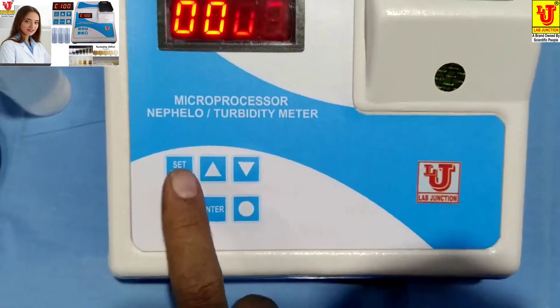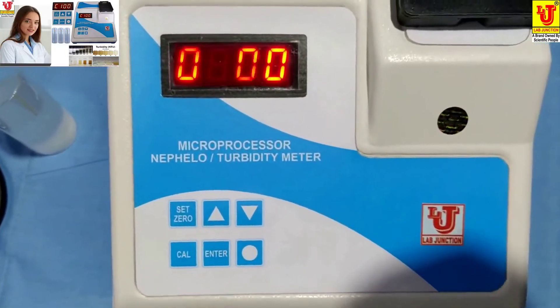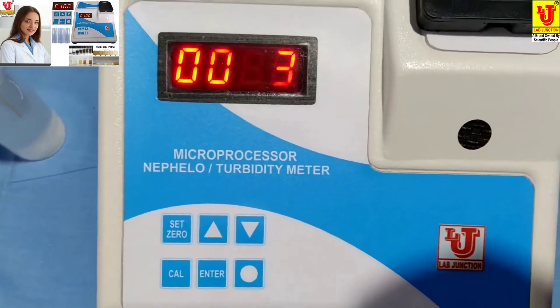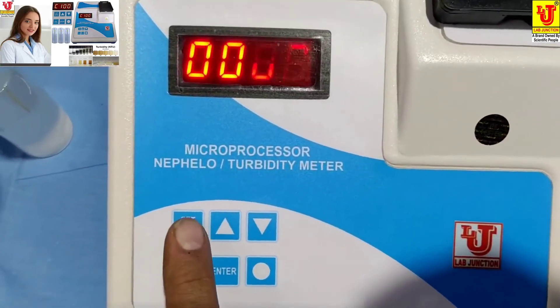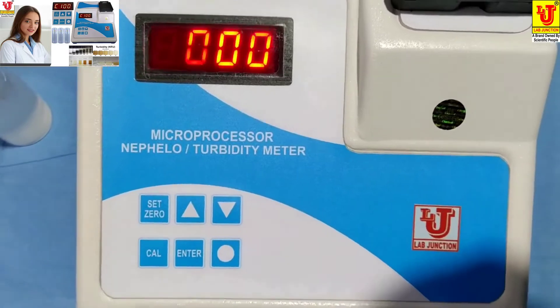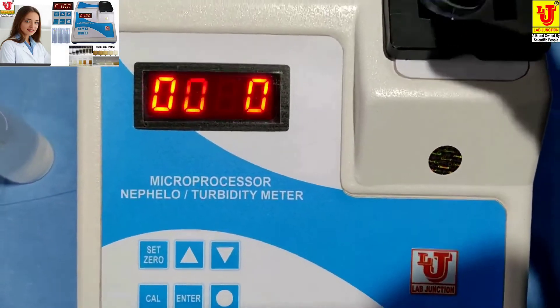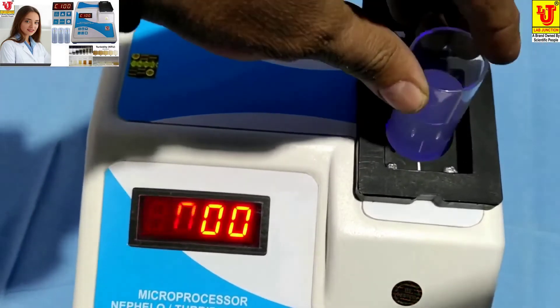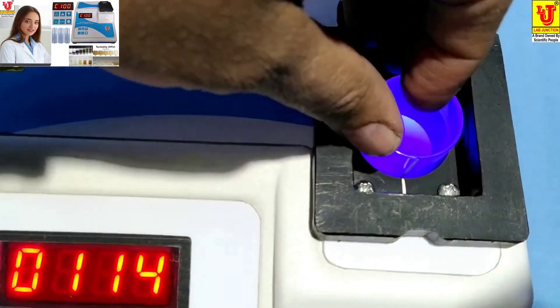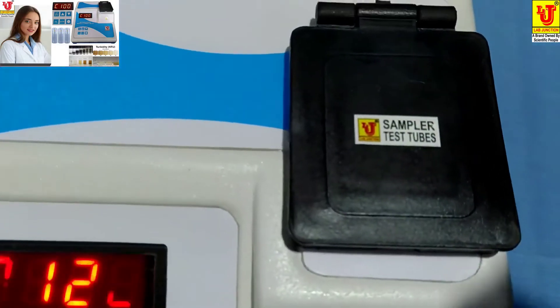Press Set Zero. Zero sets automatically. Press Set Zero again — zero sets. Now insert the 100 NTU/JTU turbidity standard solution.